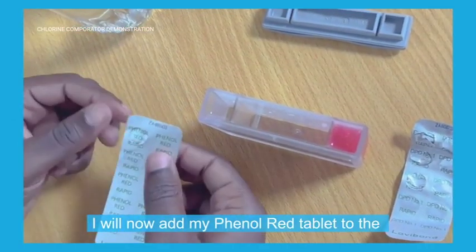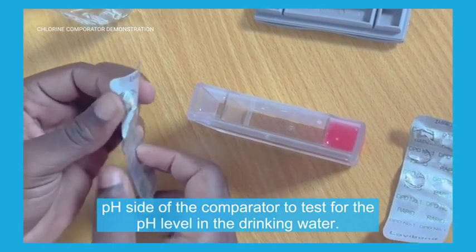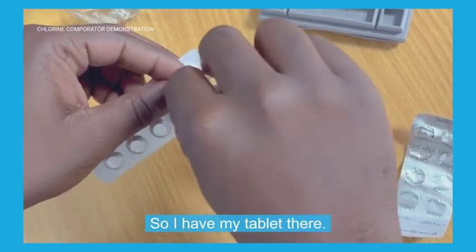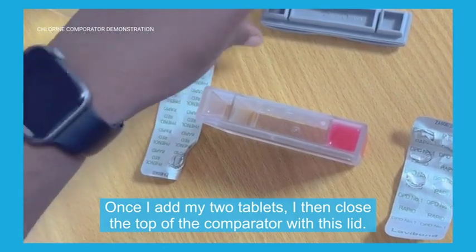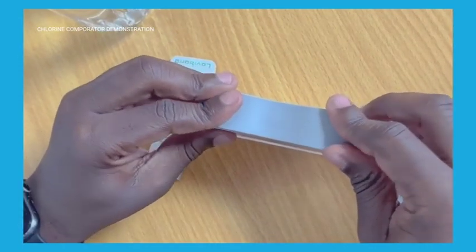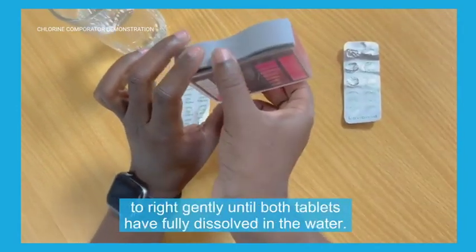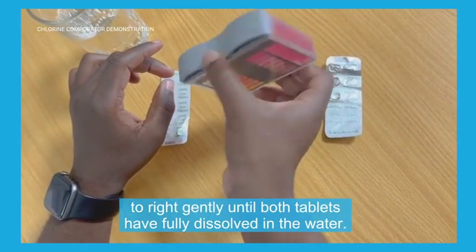I will now add my phenol red tablets to the pH side of the comparator to test for the pH level in the drinking water. Once I add my two tablets, I then close the top of the comparator with the lid. Once we have closed our lid, we then tilt our comparator from left to right gently until both tablets have been fully dissolved in the water.